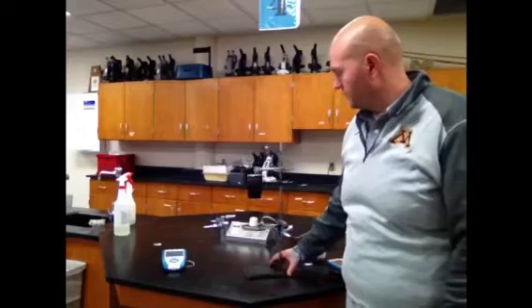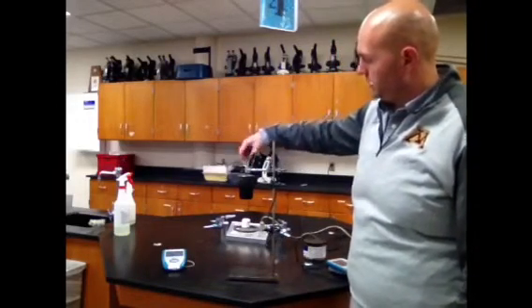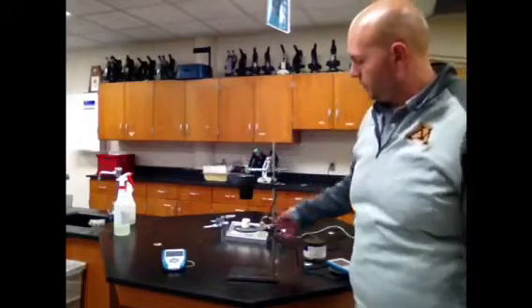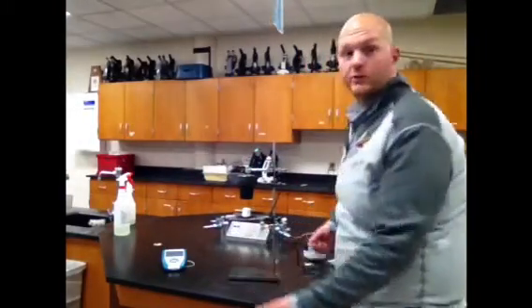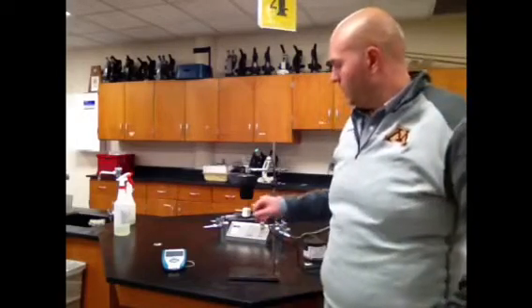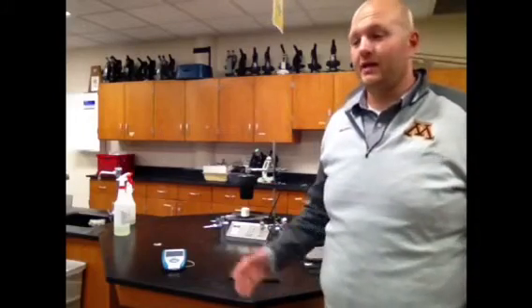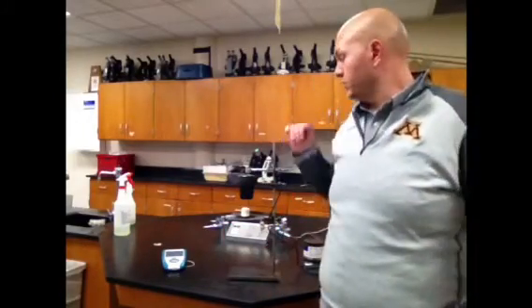Here it is. It looks a little like this. What we're trying to do, there's a thermometer here inside of a cup. We're going to put some water in that cup, and then we are going to burn some sort of chemical, in this case a marshmallow, which will represent the carbohydrate group, or a cashew, which will represent the lipid group. We're going to see how much heat will go from that marshmallow to the water we'll put into that can, and then the amount of heat will be measured by how much the temperature changes in the water inside the can. And that is relatively what the whole lab is about.